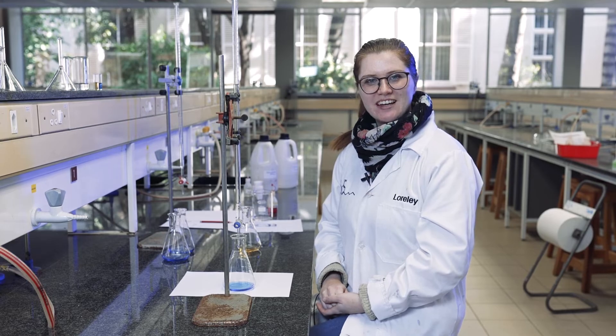Now that we've done the rough titration, we can use that value to determine how much we need to add for our accurate titrations. What we're going to do is take the rough titration value minus three millilitres and add that in one shot, then we only have three millilitres that we need to go drop by drop.